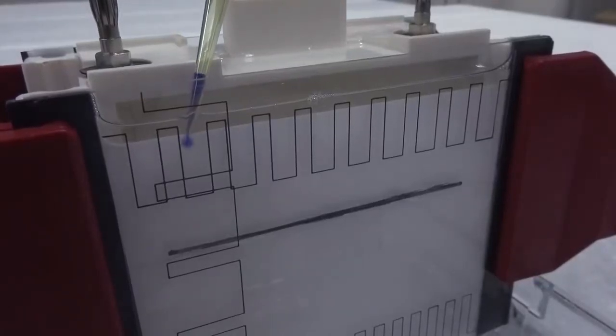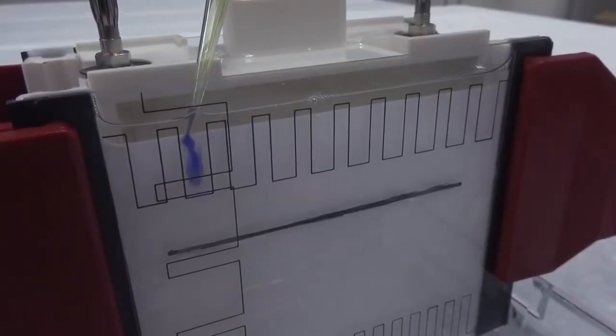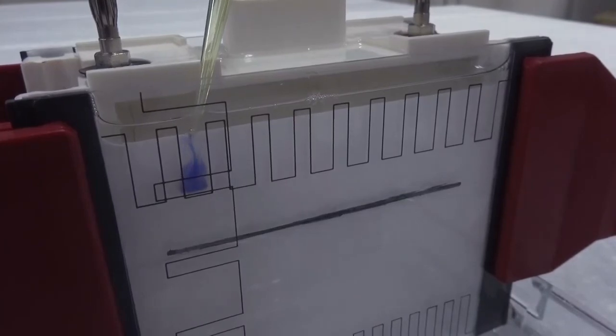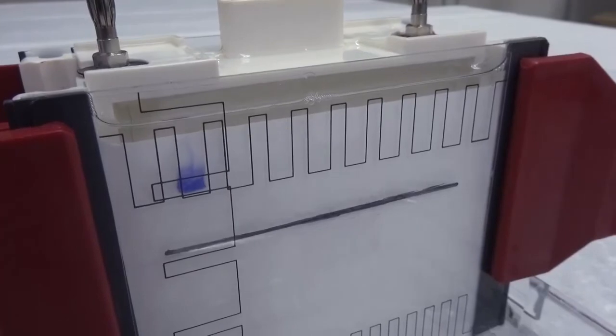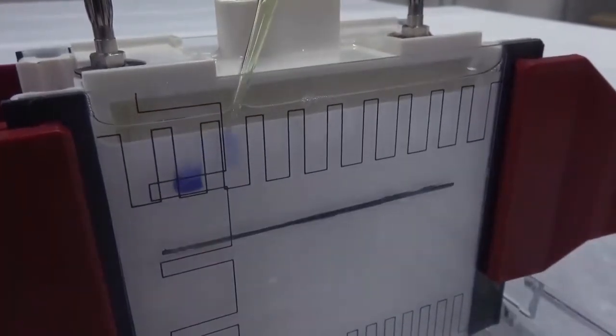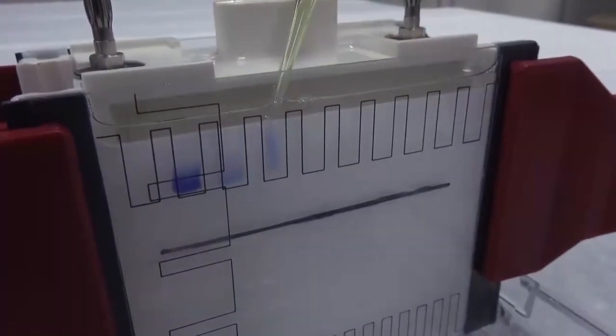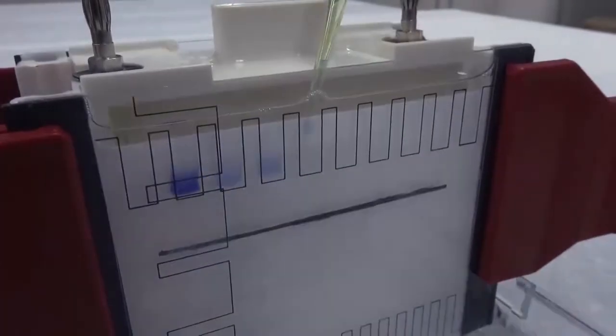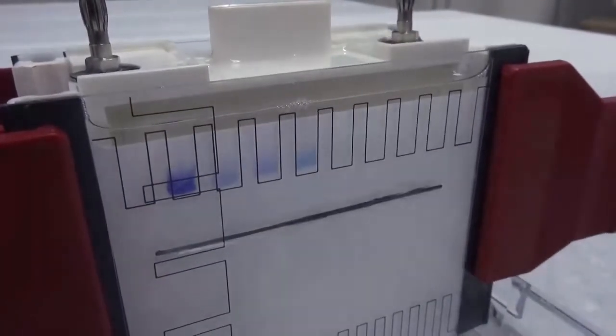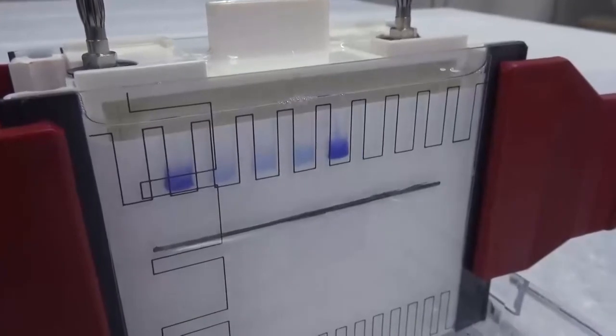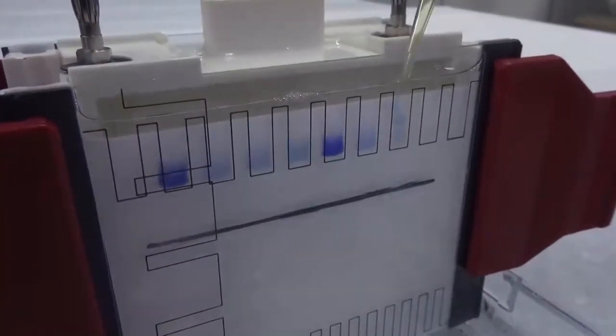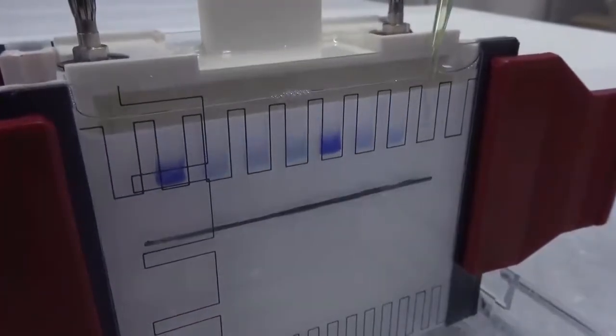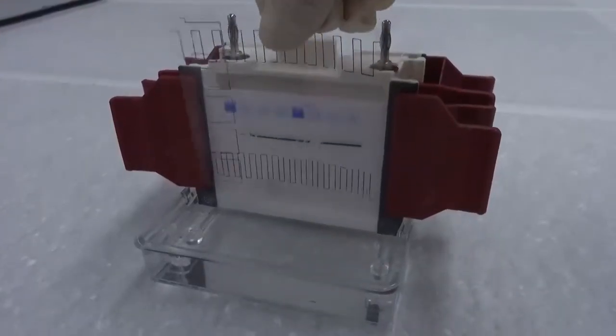Use a micropipette to take the requested amount of a sample and slowly load the sample into a sample well. You may see the sample sink to the bottom of the sample well. This is because the sample buffer contains glycerol, thus has a higher specific gravity. Continue to load all samples following the order.